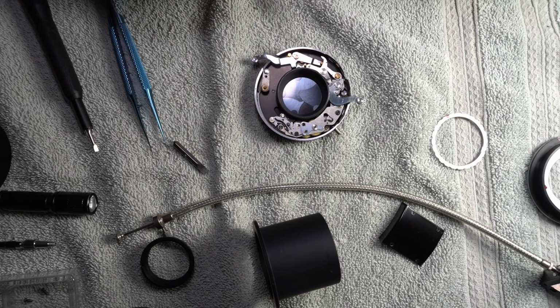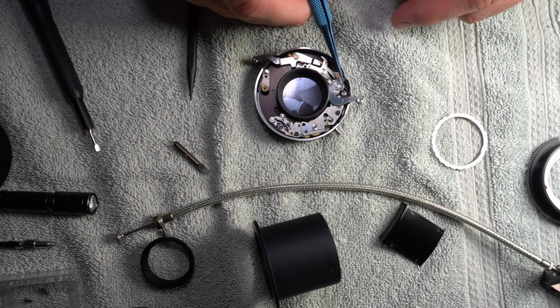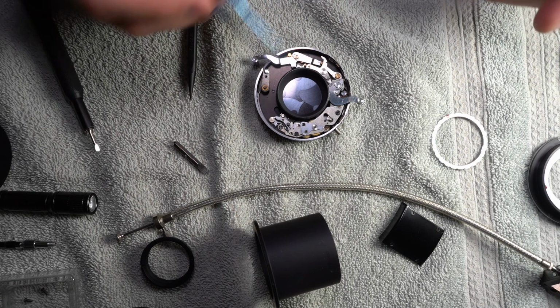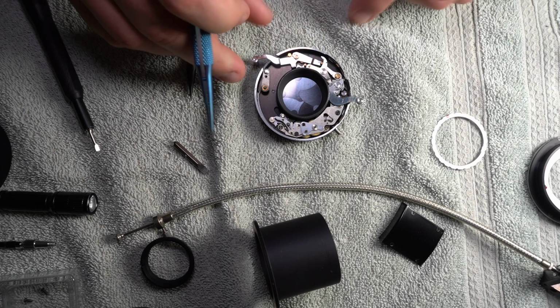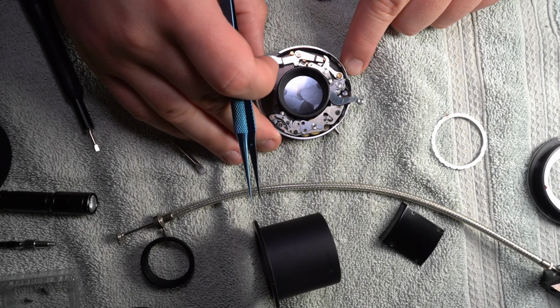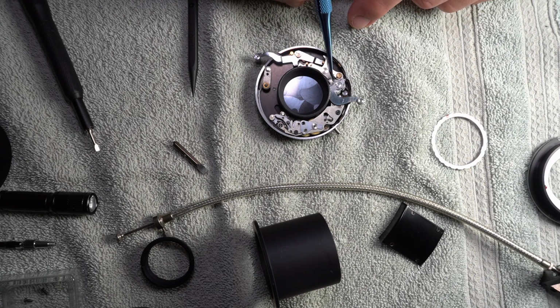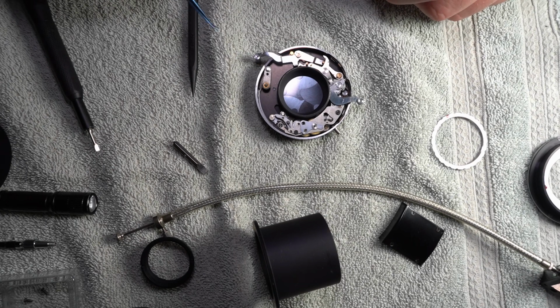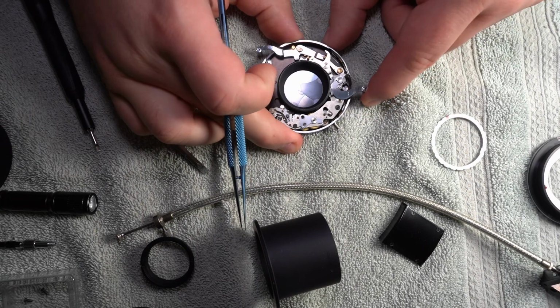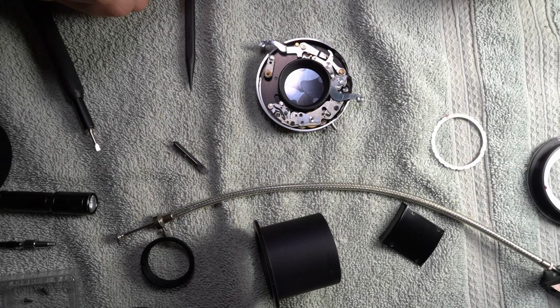Basically, I oiled the two faces in here on this spinny thing underneath this arm. I oiled those, and then I greased the two parts of this arm here. If you watch right there, boom, boom. There's a part under it that does move, and actually also contacts the spinny things here. I also oiled this moving armature down here, that thing, and it works. That actually fixed the problem.